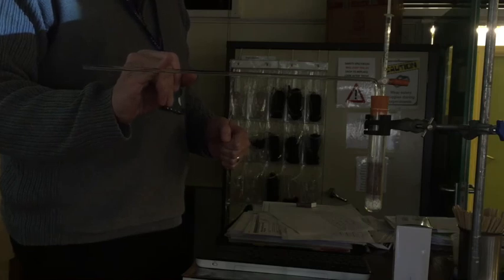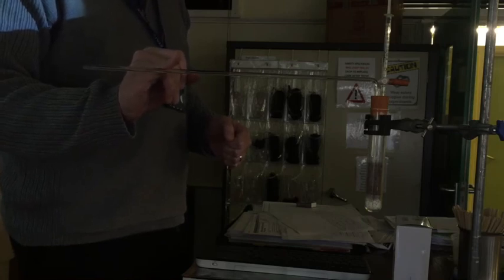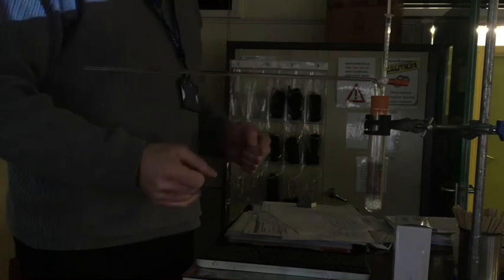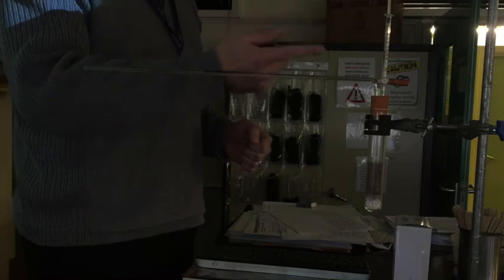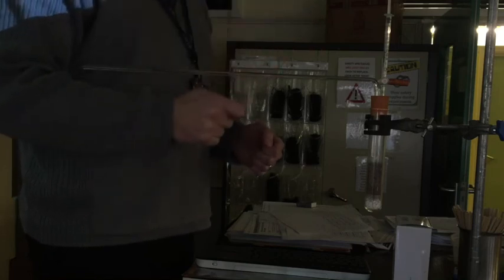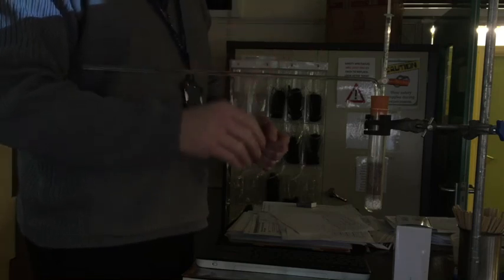Now the problem with the experiment is of course, if it keeps going it would reach the end and that would be bad, because now we have to reset it. And we can do that simply by slightly pressing in on the syringe, but that's quite complicated so I'll do that for you.